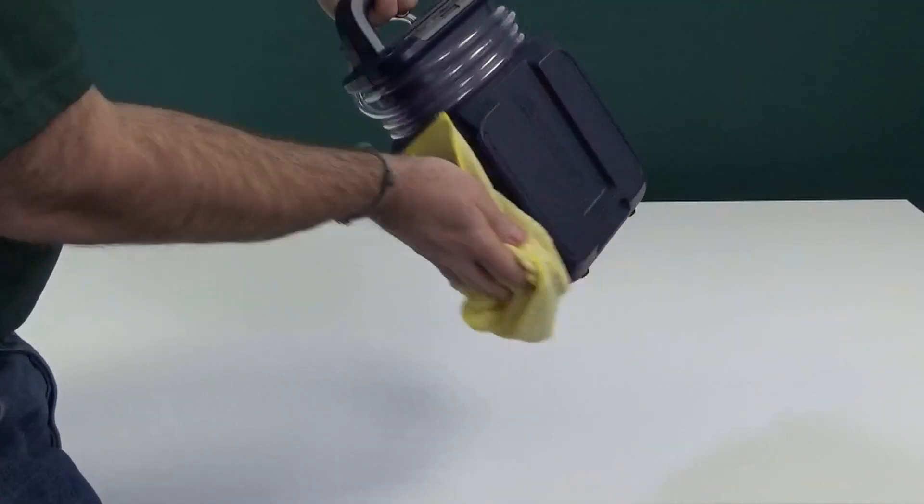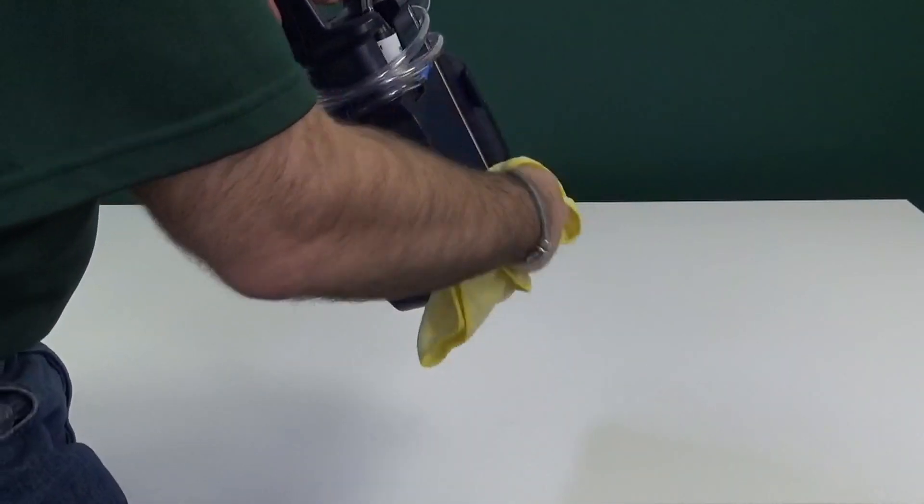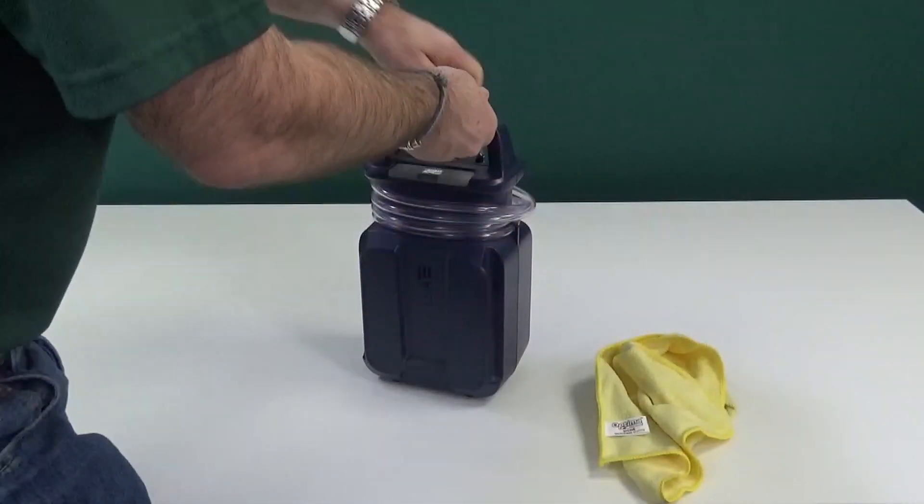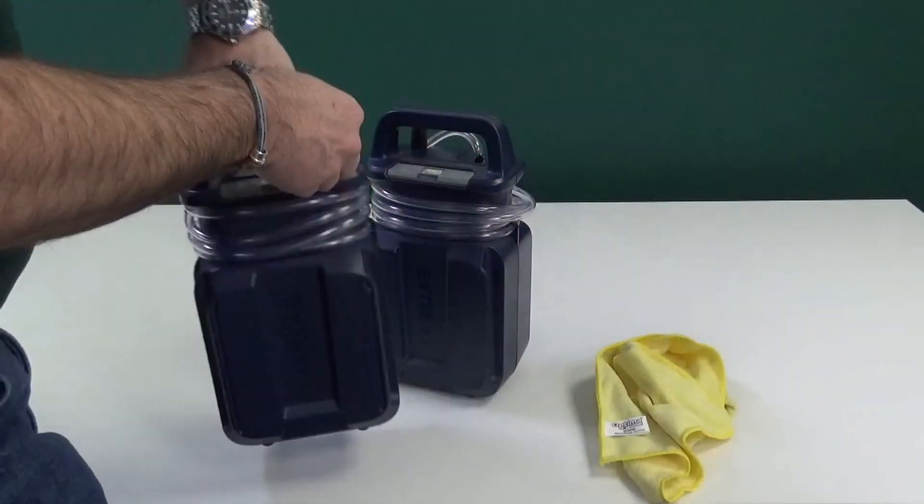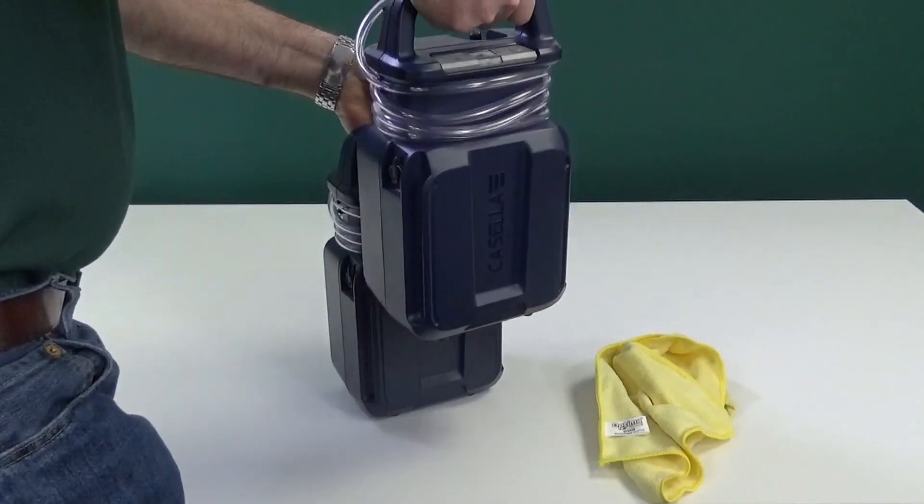The Vortex 3 is easy to clean after use or between uses. Once cleaned, it can be connected to your other Vortex 3's and then be taken away for further use or storage.